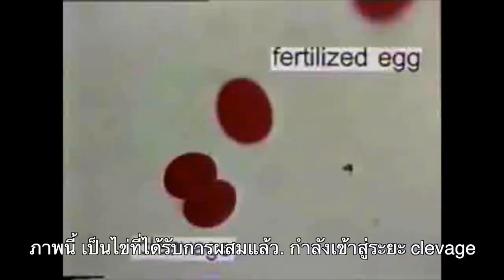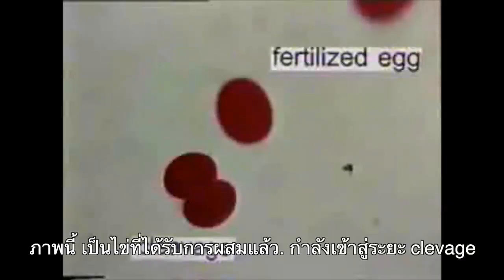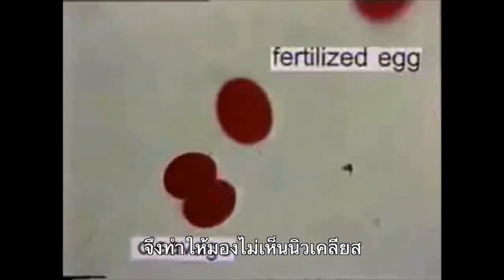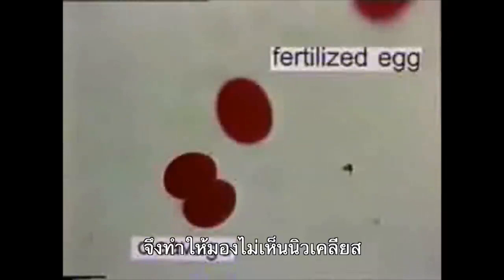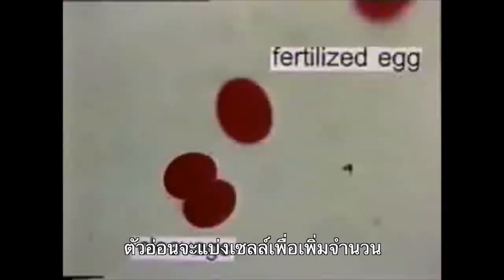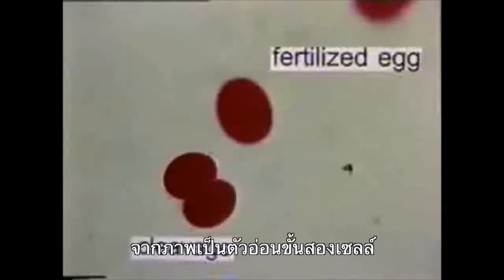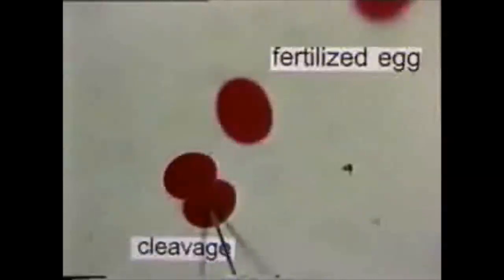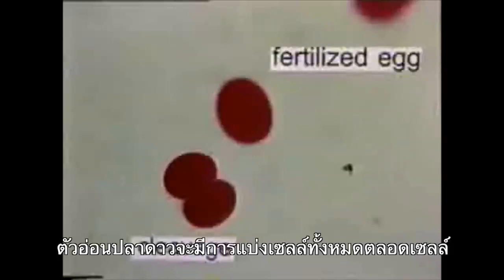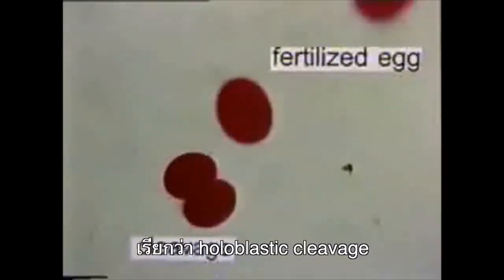Here we see a fertilized egg and another that has reached the cleavage stage. Due to changes in the cytoplasm, the nucleus is not visible at the cleavage stage. Cell division occurs and the number of cells increases. In this picture, we see a two-cell embryo. For starfish, the entire embryo undergoes cell division. This is called holoblastic cleavage.